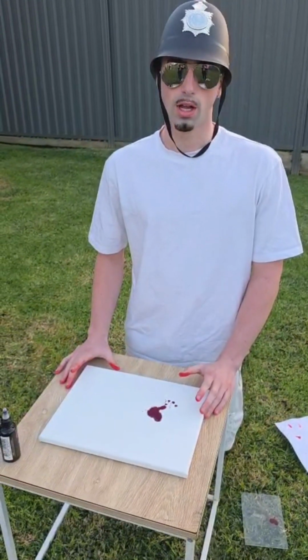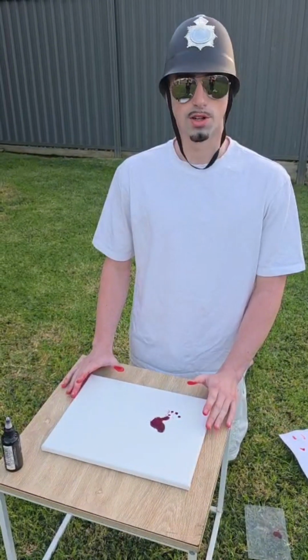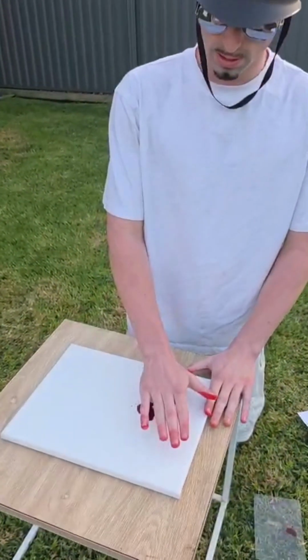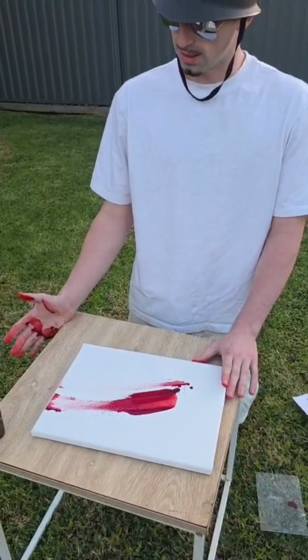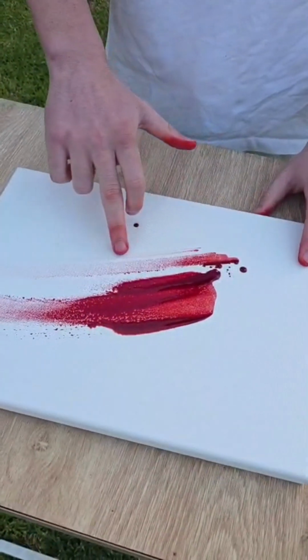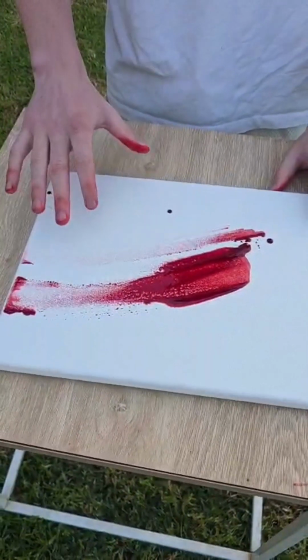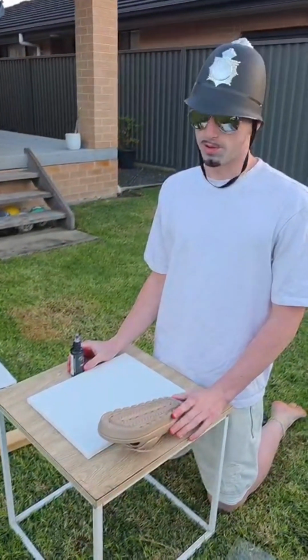From what I just did with the satellite spattering, we're going to use this as an example for transfer stains, where say someone has gotten stabbed and has tried to get up but slipped. So as you can see here, their hand has run through the blood and has gotten lighter, which causes feathering, and feathering helps interpret direction and movement.